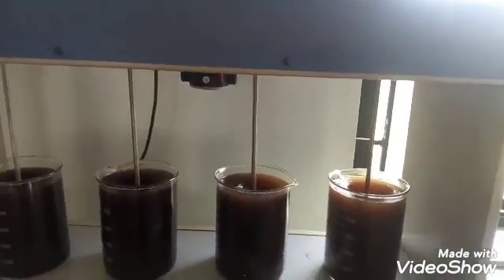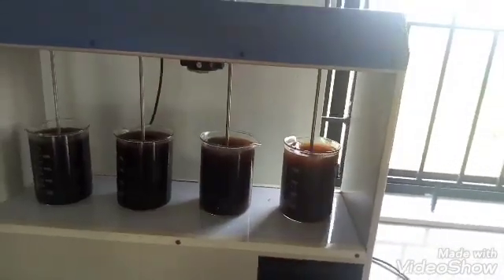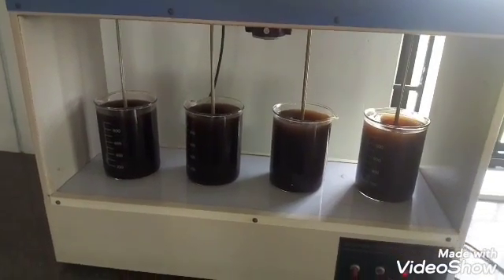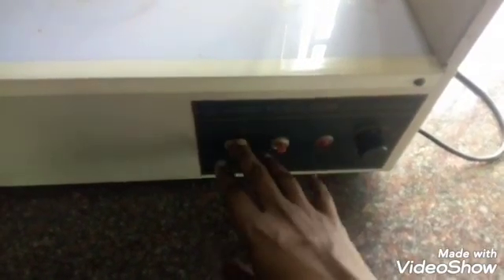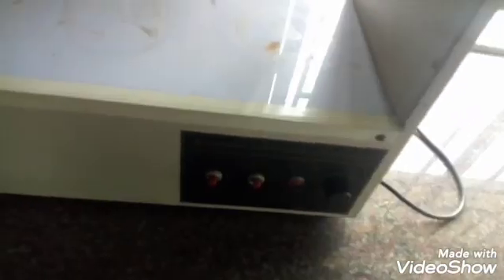We will now proceed with the procedure. For the first procedure, we will do the first stage. The experiment begins with the jar setup and the trigger is activated.